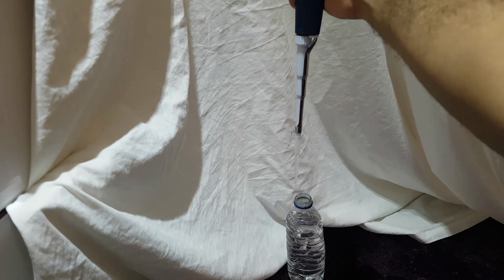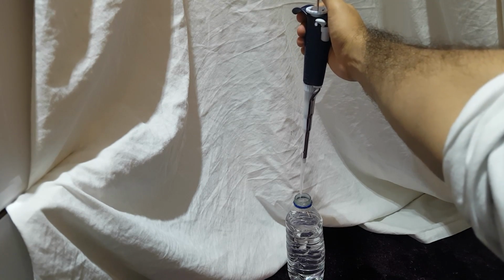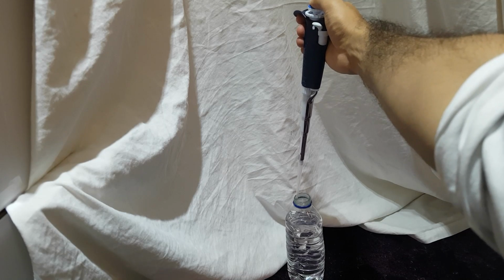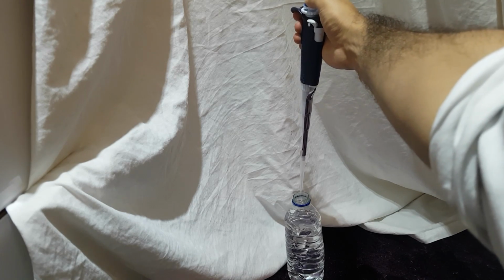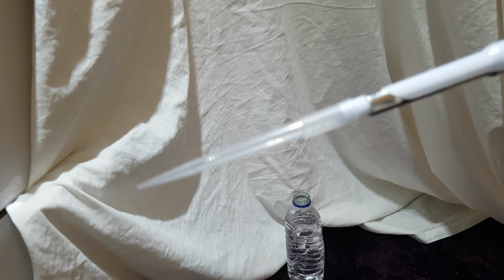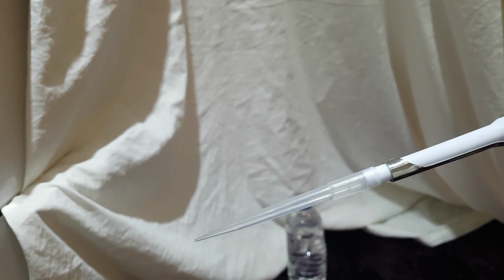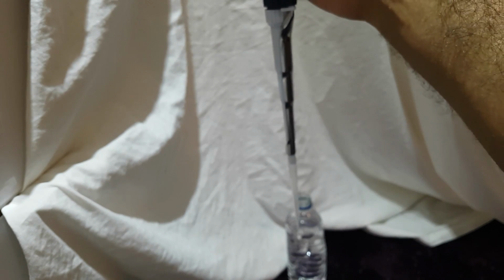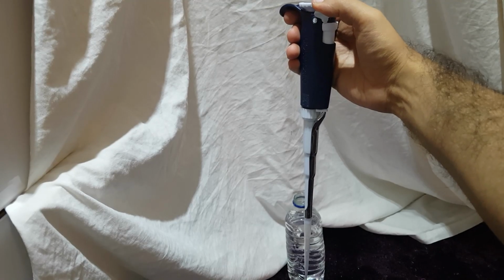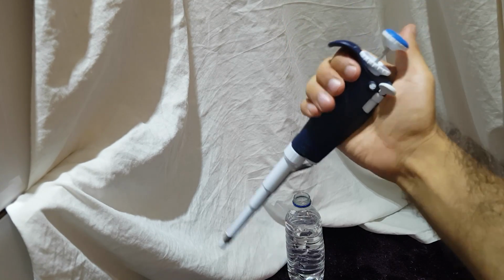All that you do is you simply go to your culture, you aim your pipette tip over it, and you just push down on the plunger, and you push it a little bit more. Now, if we have a look, we have no liquid left in here. So, next step we'll want to do is that we'll want to get rid of our tip. You simply push down on here, and there goes the tip.